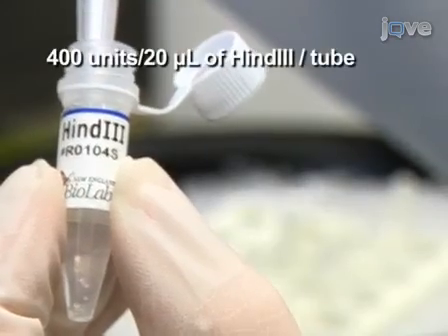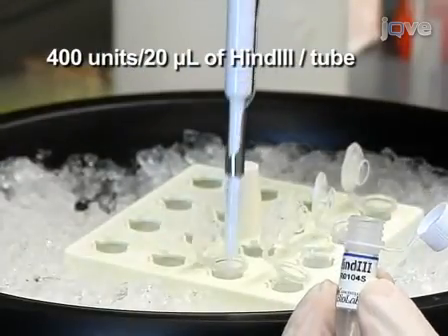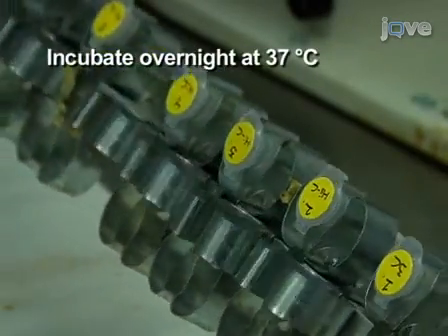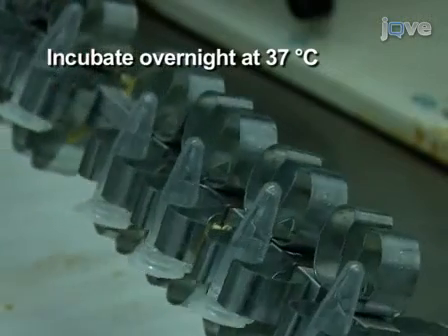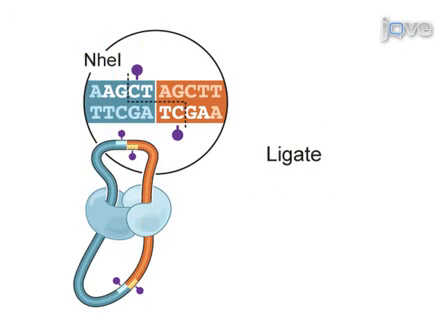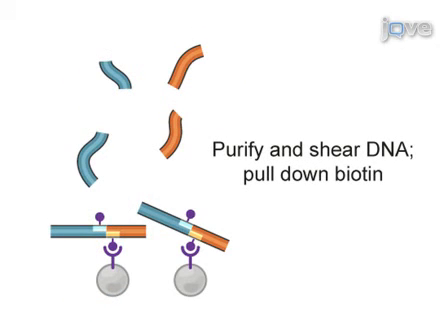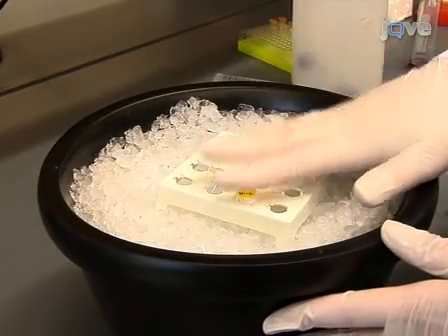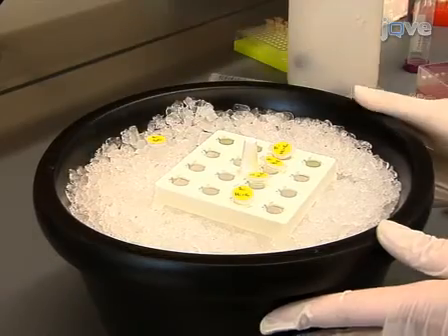Add 400 units of HindIII and incubate at 37 degrees Celsius overnight while rotating. The next steps are Hi-C specific and include marking the DNA ends with biotin and performing blunt-end ligation of cross-linked fragments. This step will allow ligation junctions to be purified later. Tube 1 should not undergo the biotinylation step and should instead serve as a 3C control to ensure that digestion and ligation conditions were optimal.